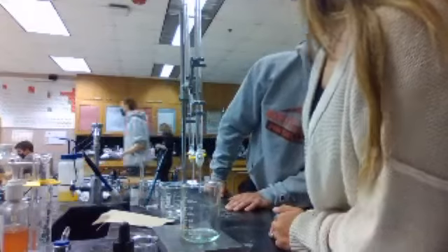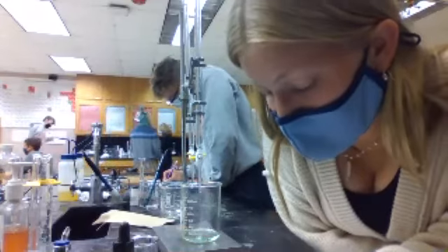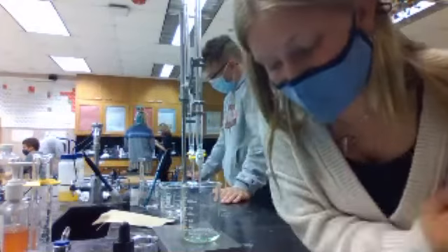I would say 19.97. Okay, so for the final volume of the base, it's 19.97. And then you subtract those to find the actual volumes.